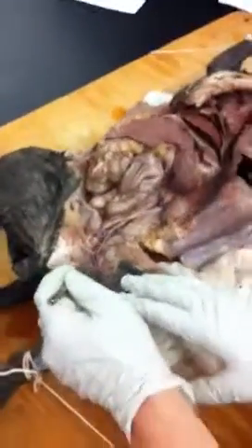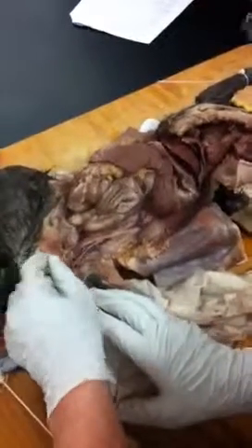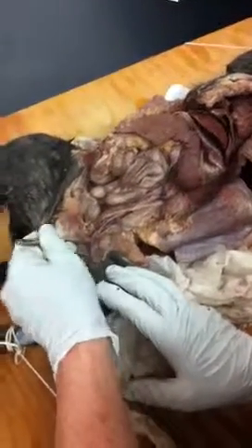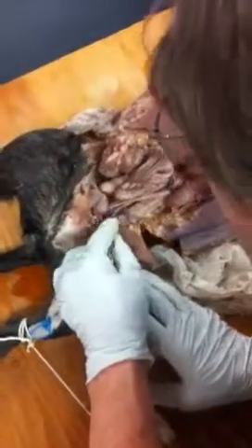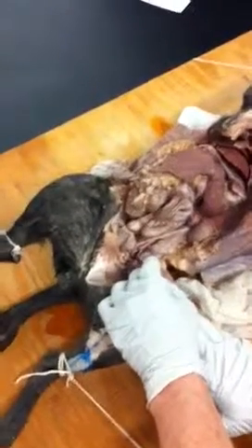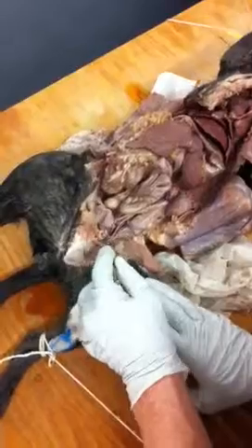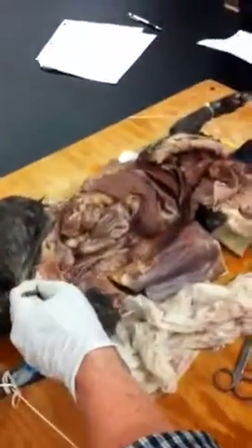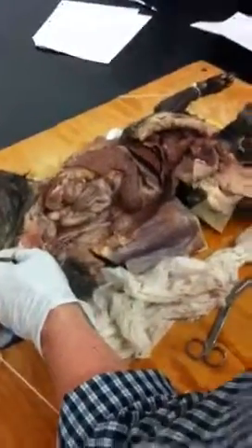Is there another Y to distinguish where it turns into femoral? To the femoral, no. There's actually a branch point here that you don't see very well. It goes into the deep femoral right about here. There's also a pudendal, which we're not going to worry about, that goes deep right over here and goes into the tail. Okay. You don't have to have that. So, well, we have a pudendal artery. It's the same. Goes in for the coccyx and also part of the genitalia.